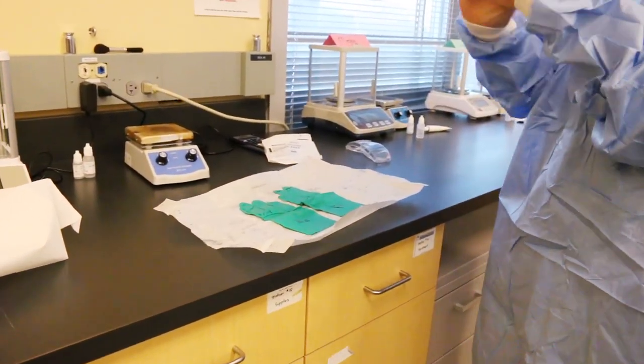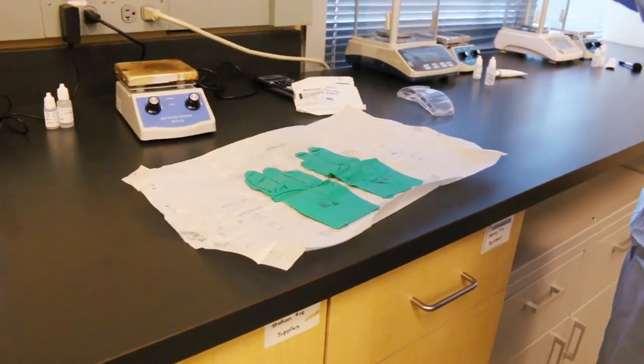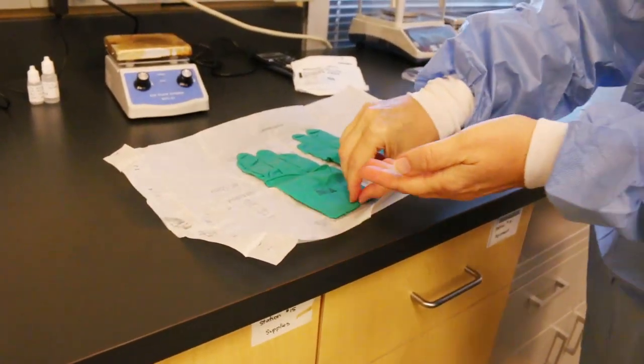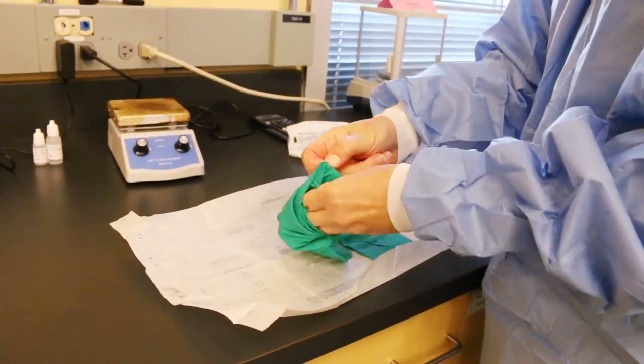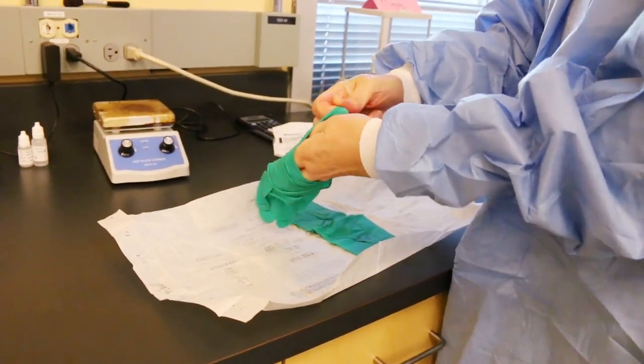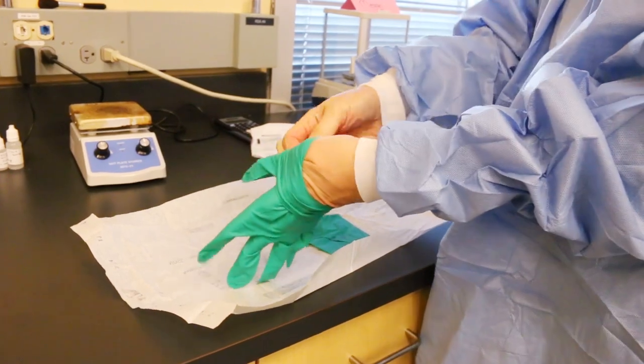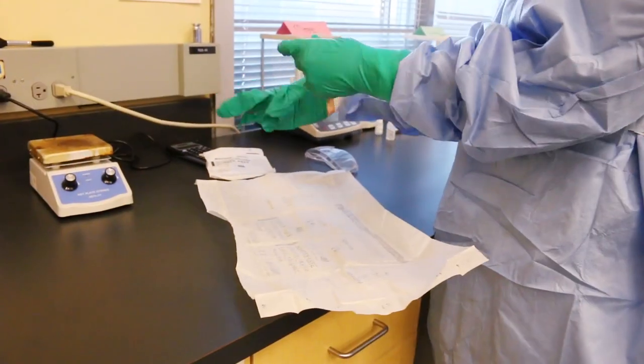Step 26, when the glove package is open, place the left glove on the left hand by grasping the inner part of the cuff with your right hand and pulling that up onto your left hand. Repeat on the right hand.